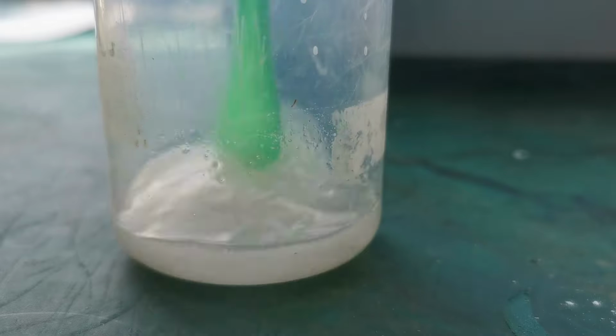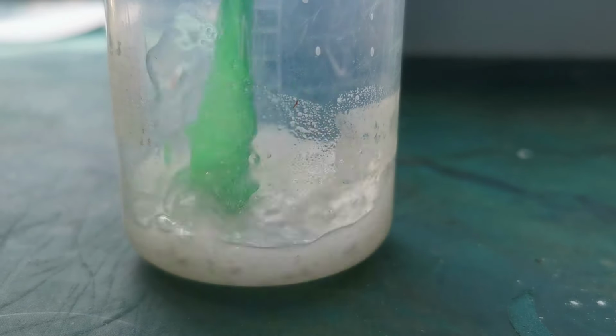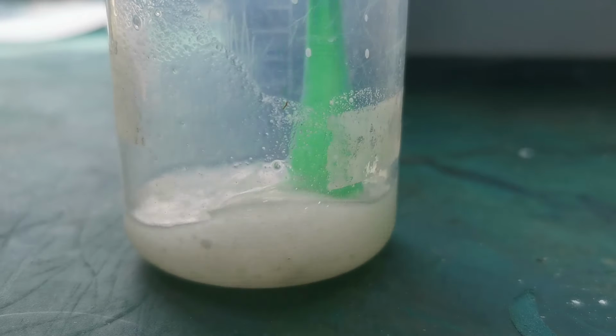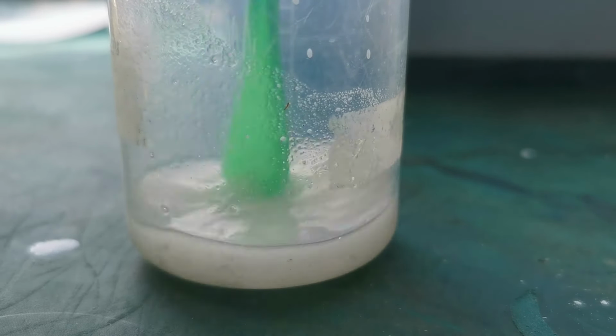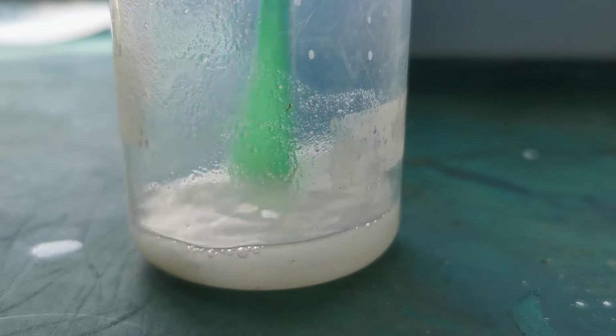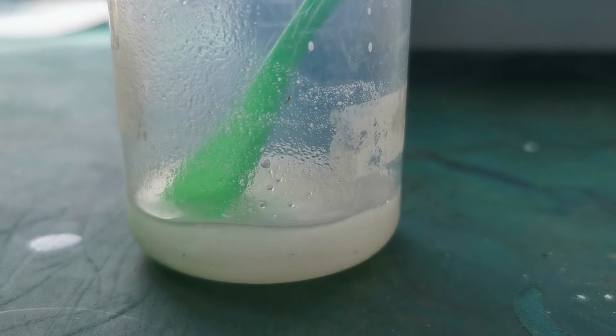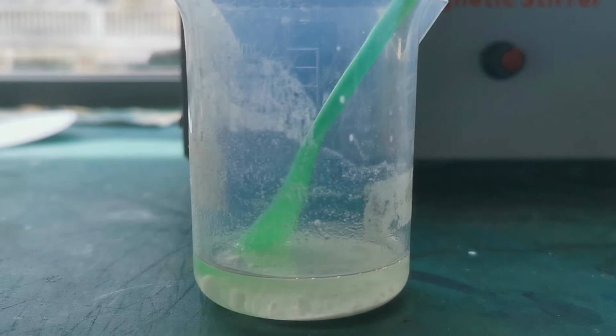So I started with a small-scale test. I ground 2 grams of TCCA into a powder and dissolved it in a small amount of dichloroethane, or DCE, that I distilled from paint thinner. This not-so-pure solvent might be a reason why the entire experiment failed, as the paper called for using DCM instead of DCE. After a few minutes of stirring, there are still some undissolved solids.